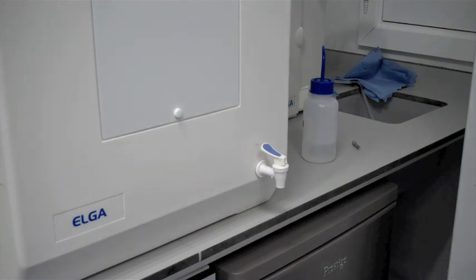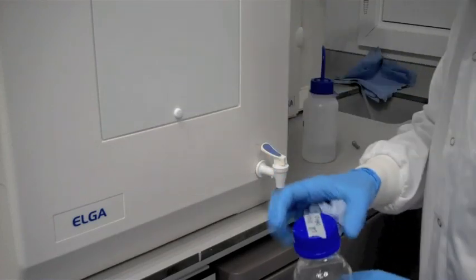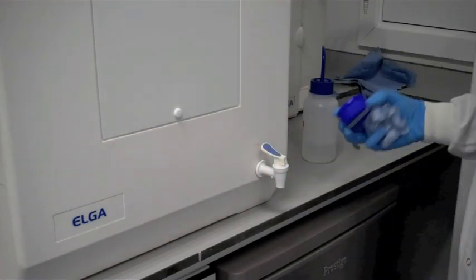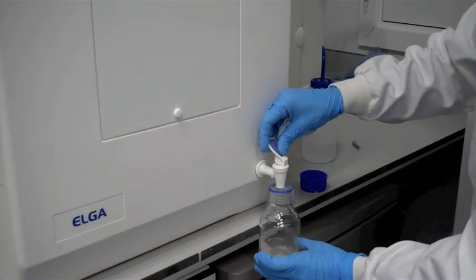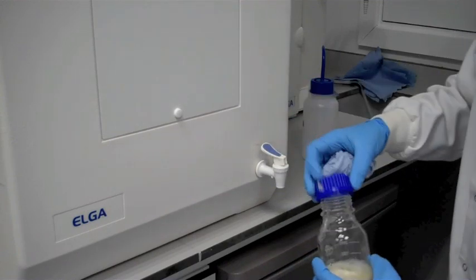Okay, we're now at the distilled water. We have our agar bottle which we prepared just a few moments ago. Take the top off and put a little bit of water in, like so. Not too much, just a little bit.